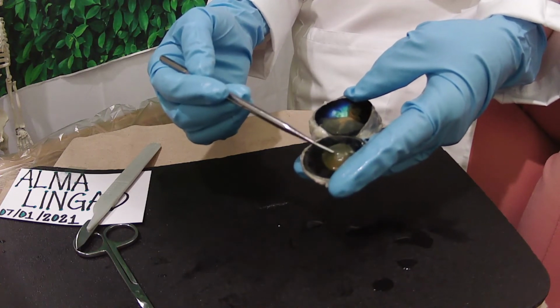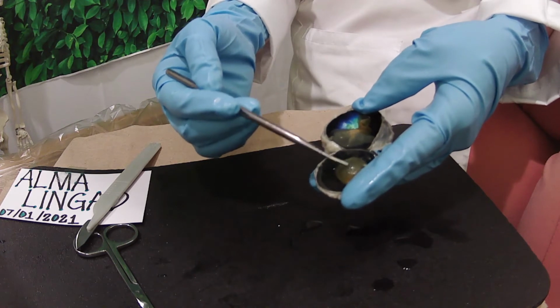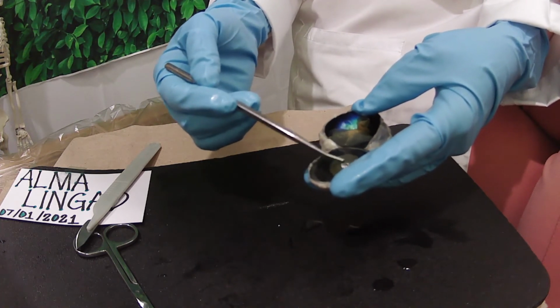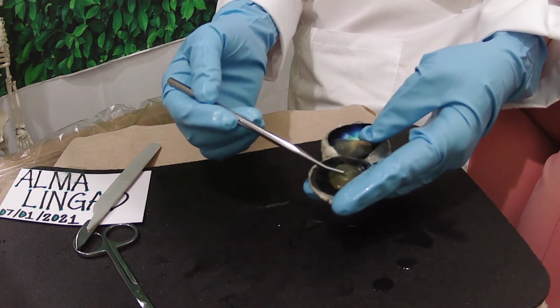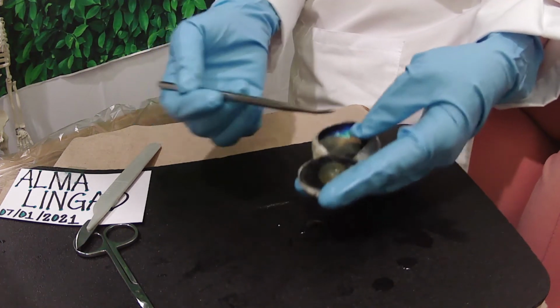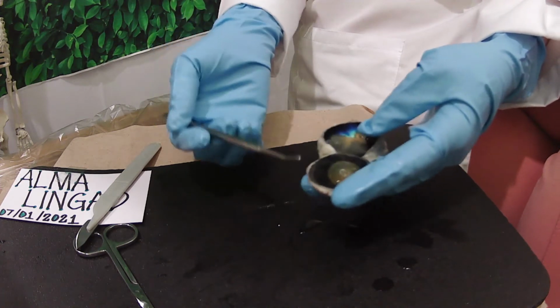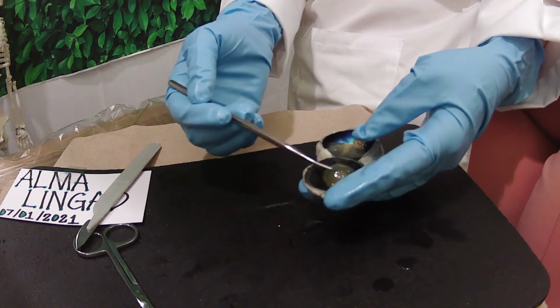So this is the lens of the eye. It is located directly behind the iris and the pupil. It is the second part of your eye, after the cornea. It helps to focus light and images on our retina, of objects and people that are either nearby or at a distance. The lens provides 25 to 35% of your eye's focusing power.